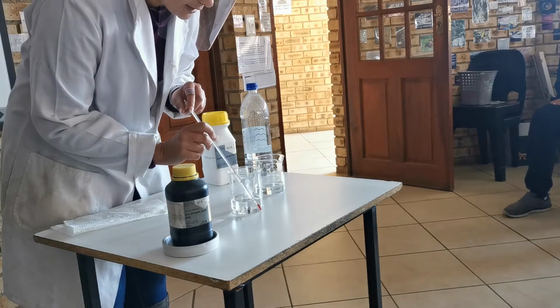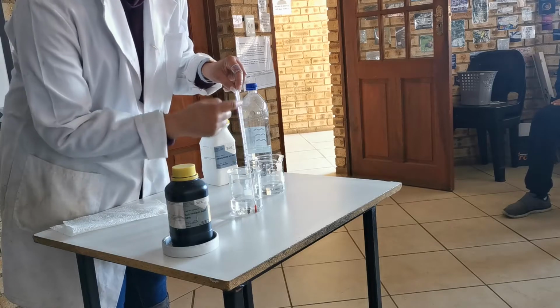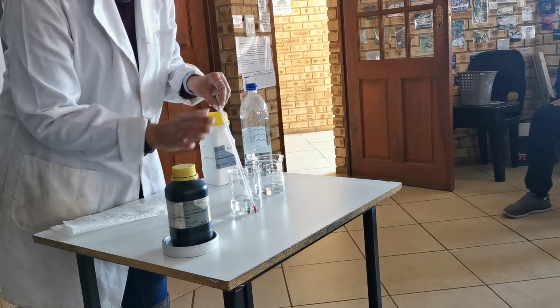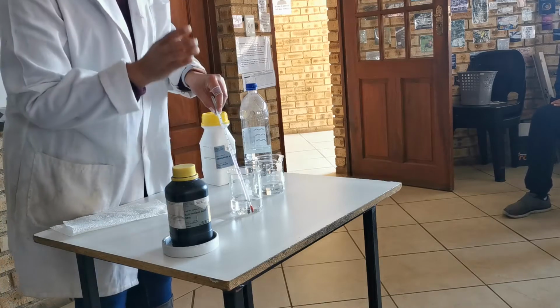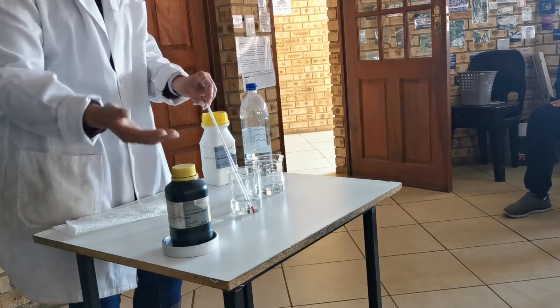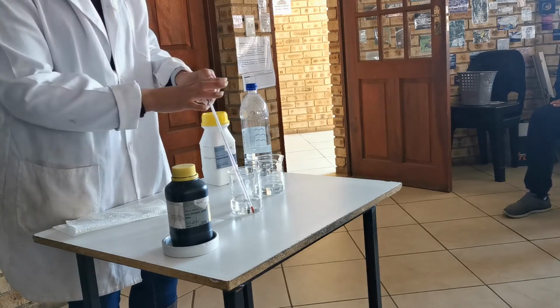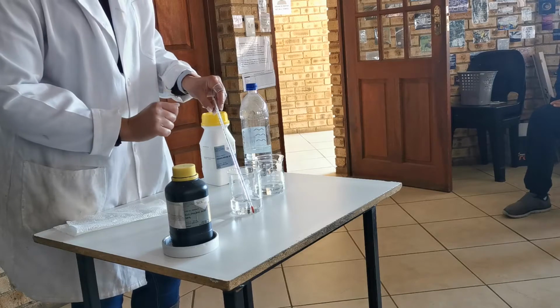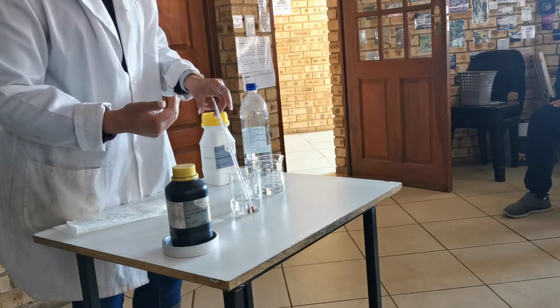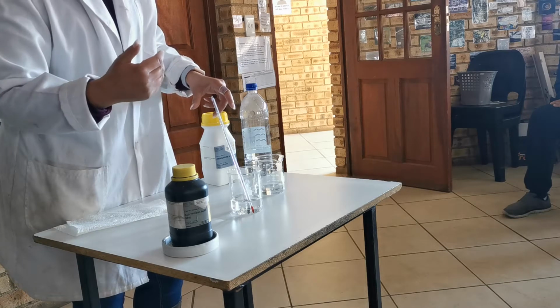The first thing I'm going to do is allow the thermometer just to acclimatize and to get the temperature of the water, which should be very close to room temperature. That kind of makes sense. The bottle's been in the room, so the water in the bottle will be the same as the room temperature. Are we okay with that? Now we're going to describe where this energy comes from in a minute. For now, we're just going to have a look at what the energy actually is.